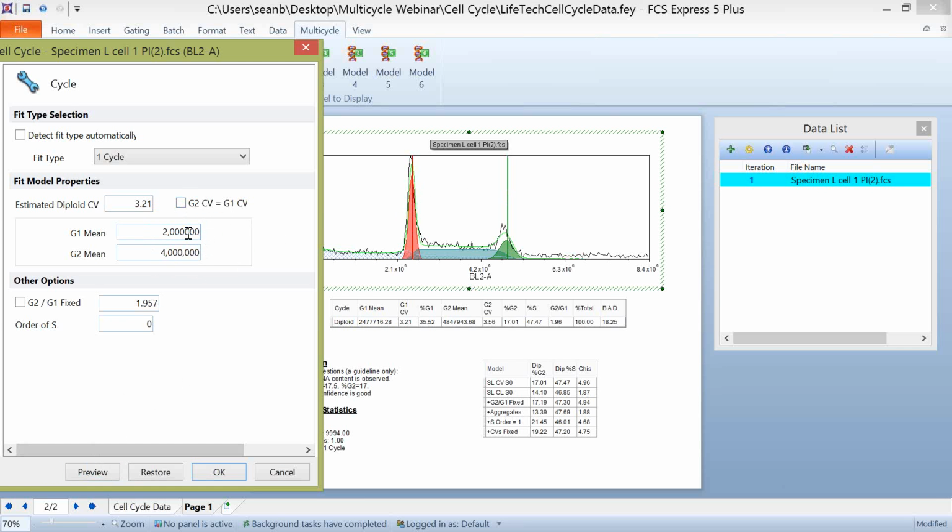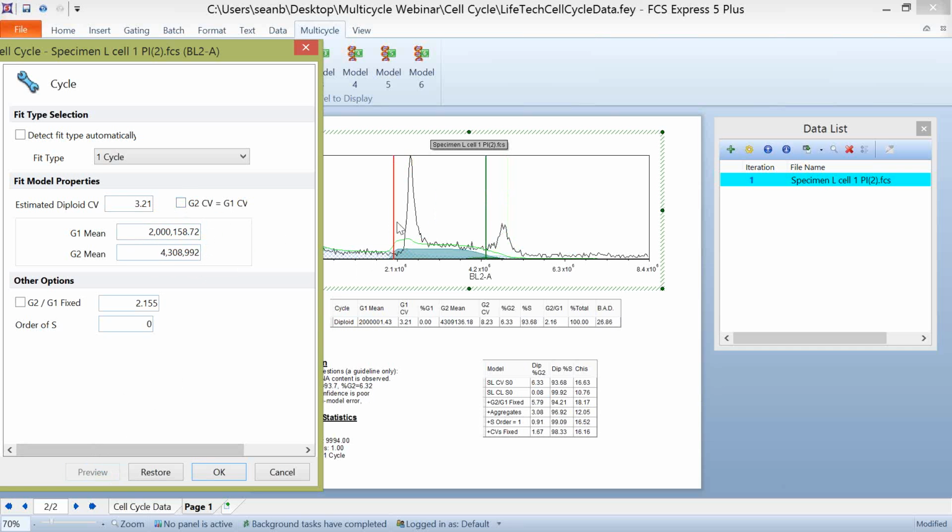So if I wanted to manually input a value of 2 million here, we're automatically going to try and use double that for the G2 value. We click preview, and we can see how that changes on our plot. We can see that we've moved this G1 mean because we inputted 2 million. We've slid our G2 mean, and we've also adjusted for the G2 to G1 ratio that Multicycle is determining to be the best fit for this. So again, you can come in here and change these values if you'd like.